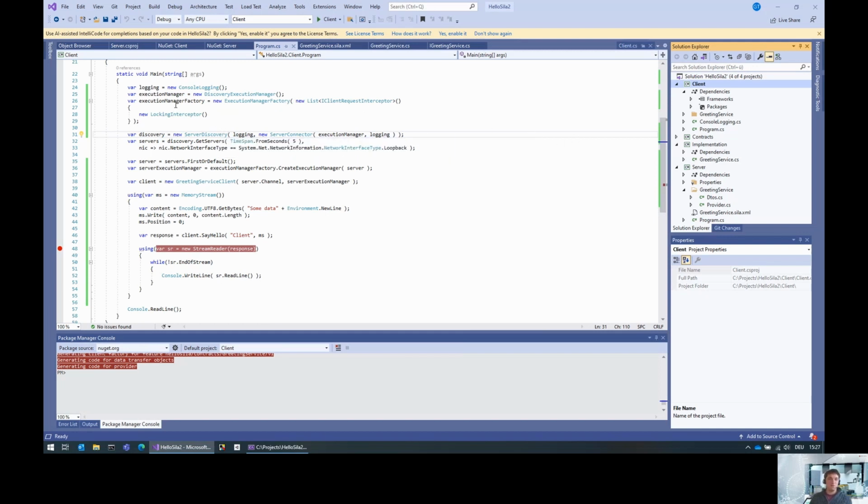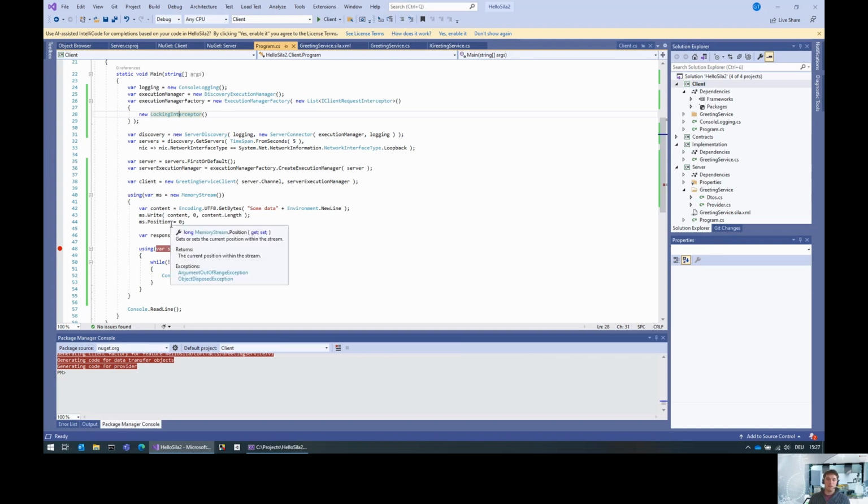You will see in one of the previous videos, I created this execution manager factory that still has the locking interceptor inside it, to support locking also. If we have binaries, then we have to use something like the execution manager factory. We cannot just use the discovery execution manager. The reason is that the discovery execution manager does not support binaries and does not support metadata, because the discovery doesn't use metadata or binaries and is used before the complete connection to the server is actually established in the SDK.